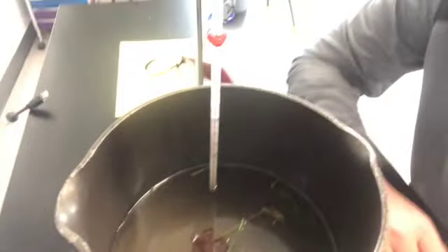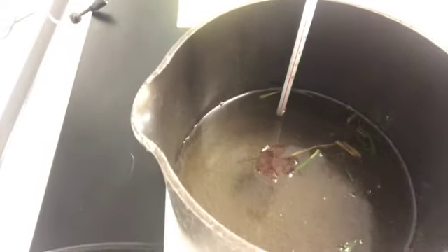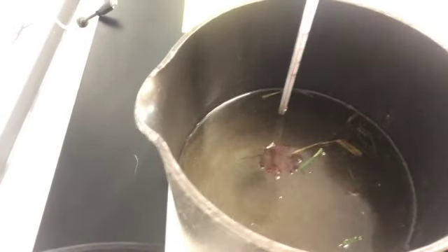You guys should try and start thinking. It's like when you're making macaroni, right, at home. It's about time to put those noodles in there. All right, here we go. Another 5 minutes.